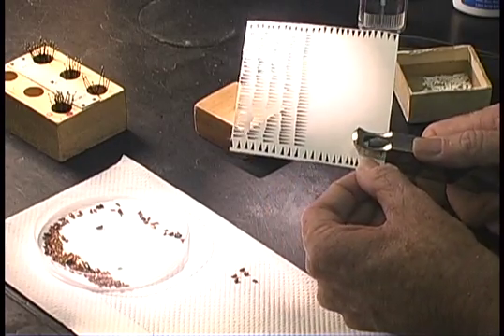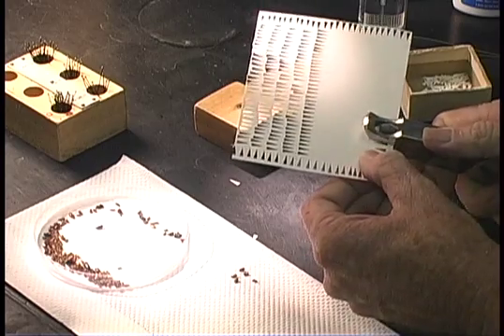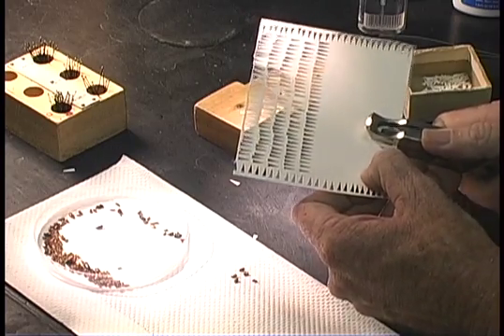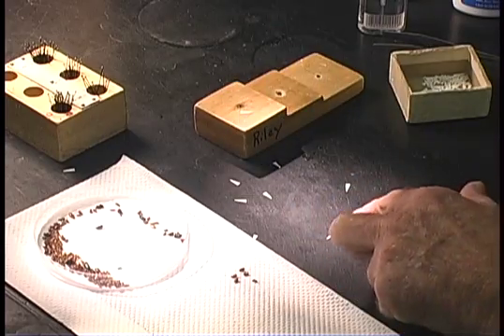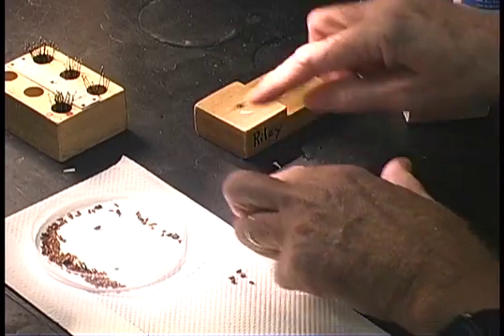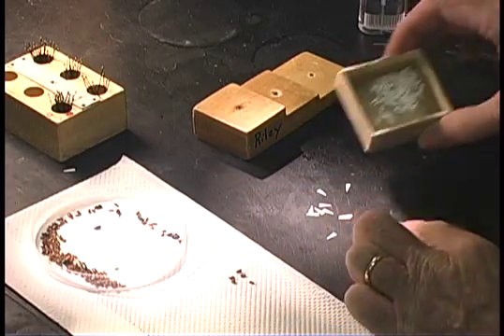These point punches come in a number of styles, but they are very similar. What you want to make sure you get is a very fine tip on the points that are produced.